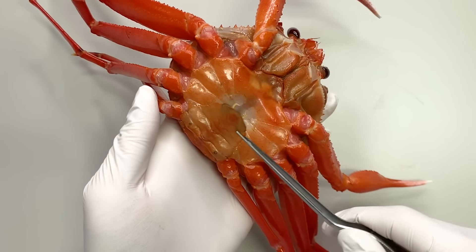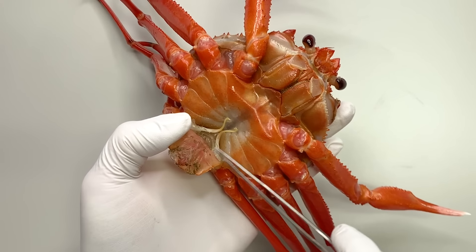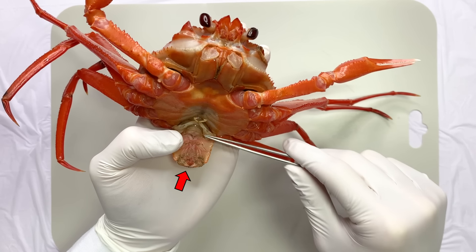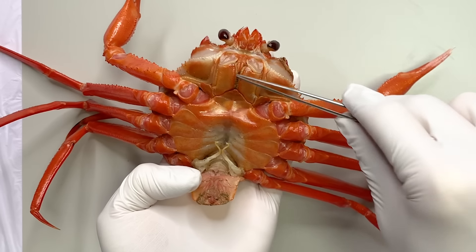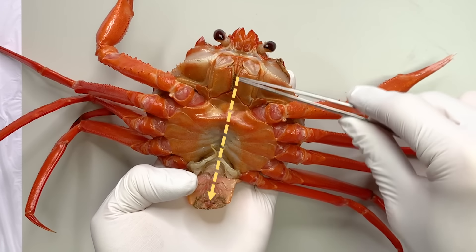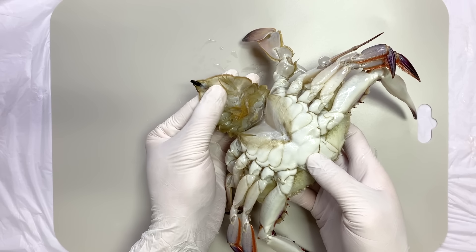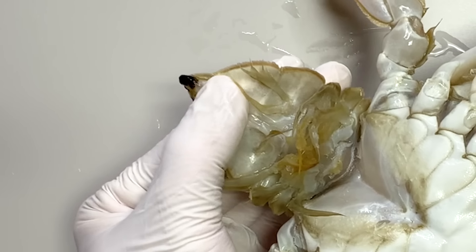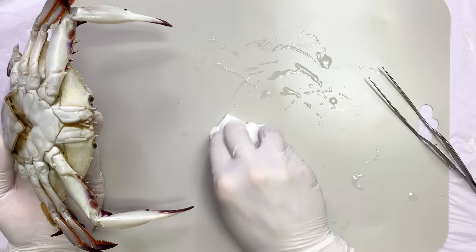So, if we open the abdomen, it unfolds like this. The end part of the abdomen is the anus. The digestive tract extends from the mouth to the anus. So, when you press this area, feces come out. Therefore, crabs usually excrete waste near their faces.